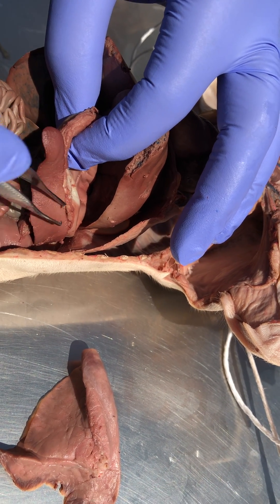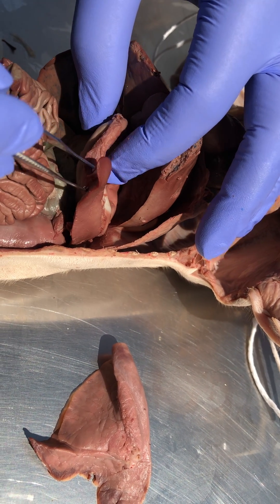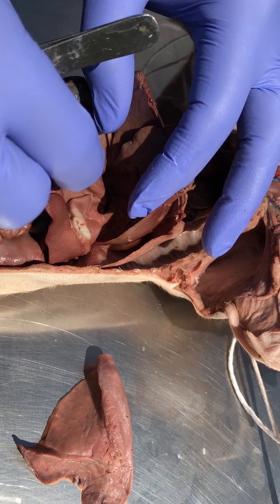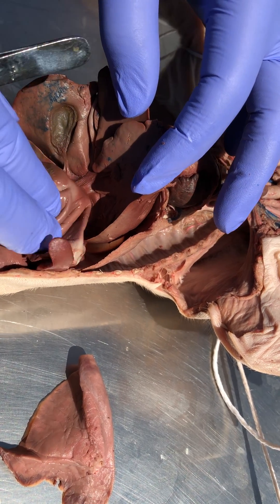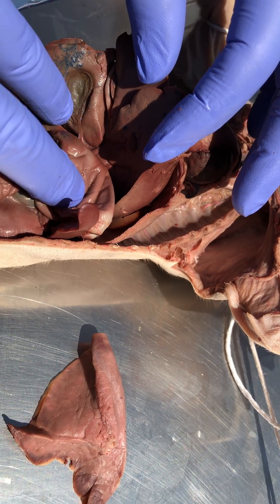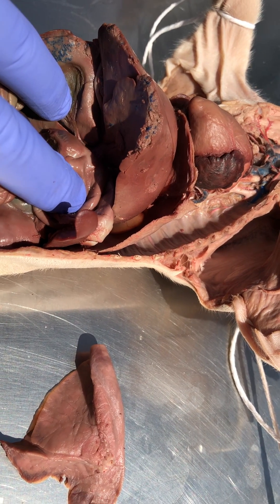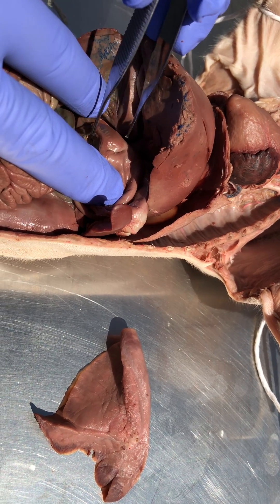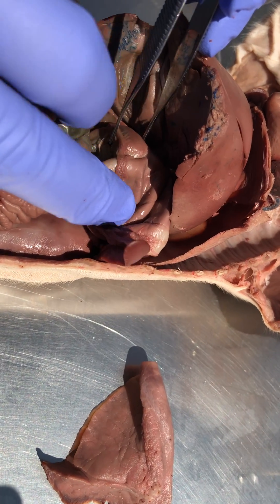Alongside the stomach we have the circulatory structure, the spleen. The stomach is large and sac-like; in this case it's empty. You can tell the distal end of the stomach — distal relative to the mouth, so the downstream end — is going to be this really, really thick knot.